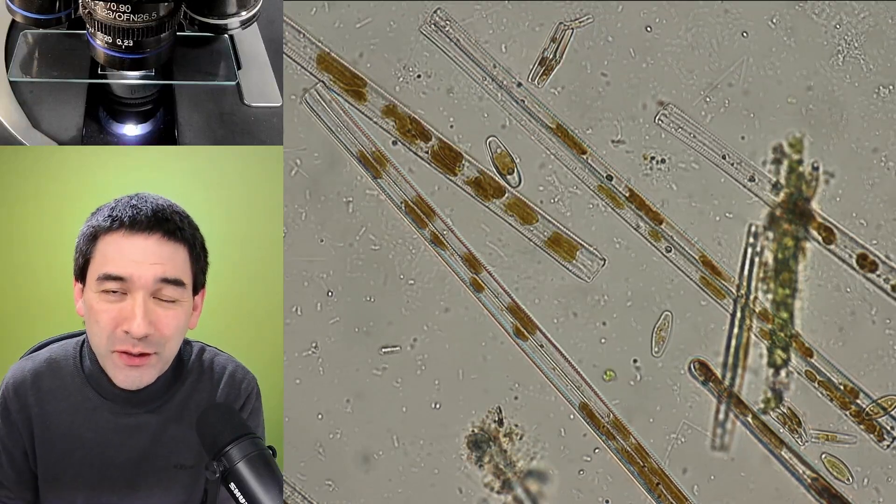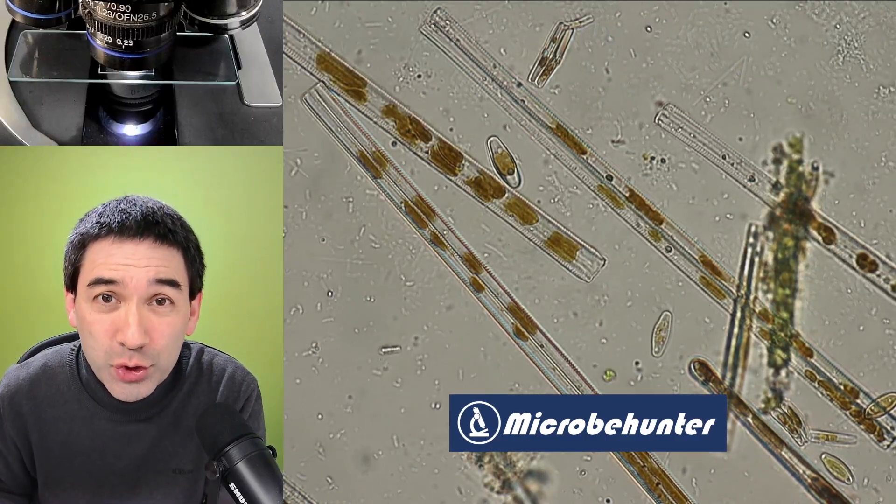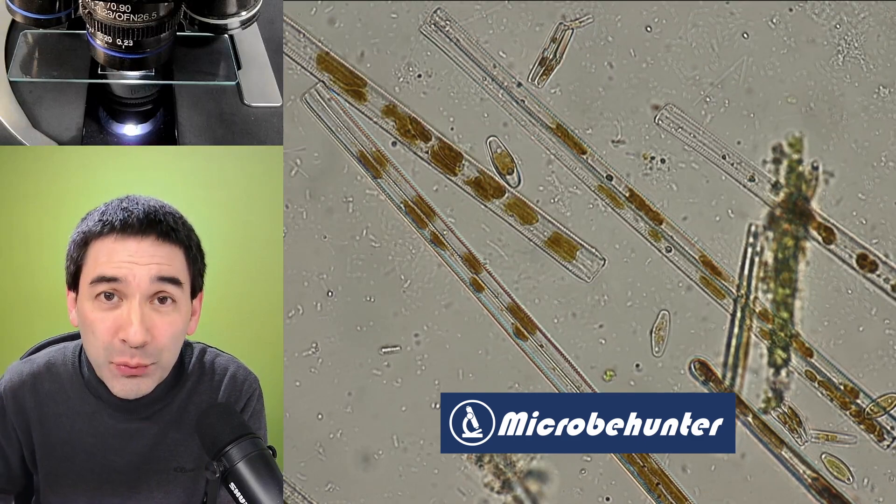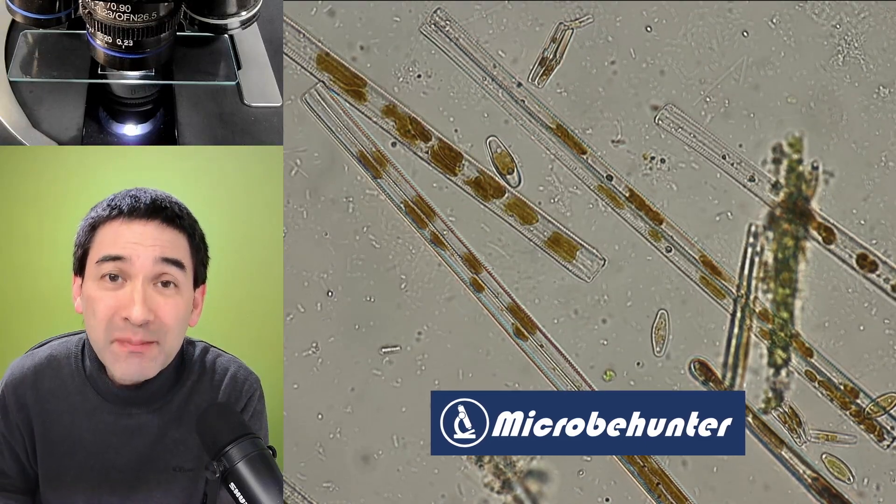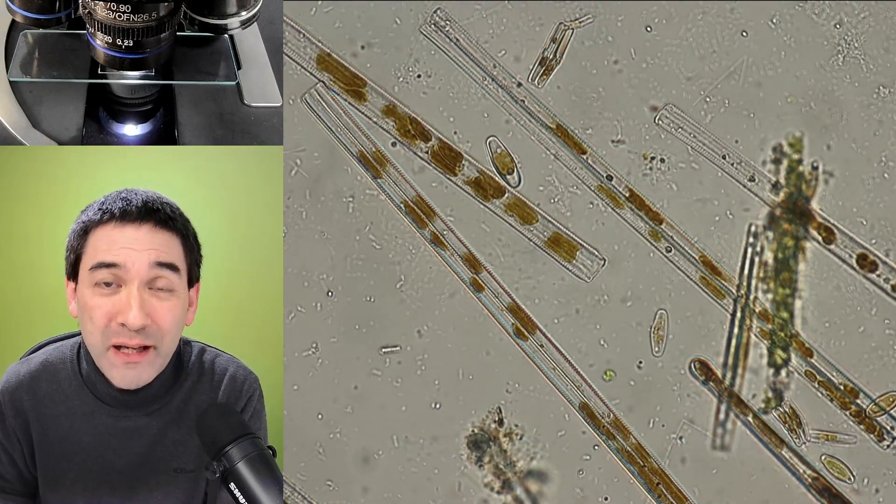Hi, hello, and welcome again. Microbe Hunter here, and today in this video I would like to show you the effect the different mounting media have on the specimen quality of a microscope slide.